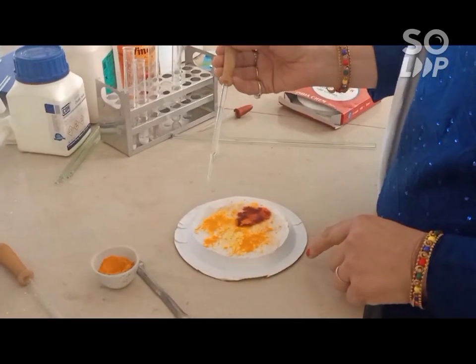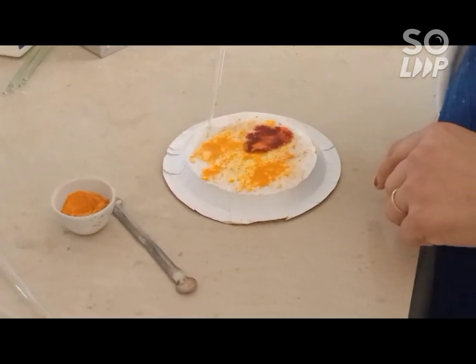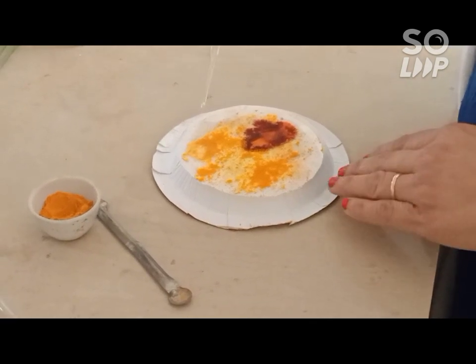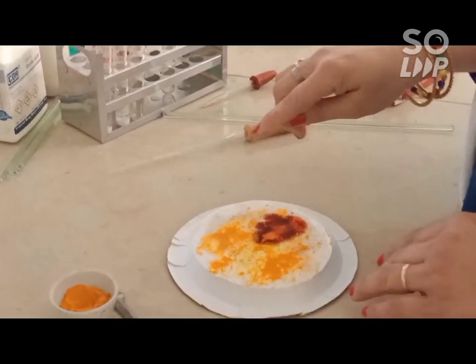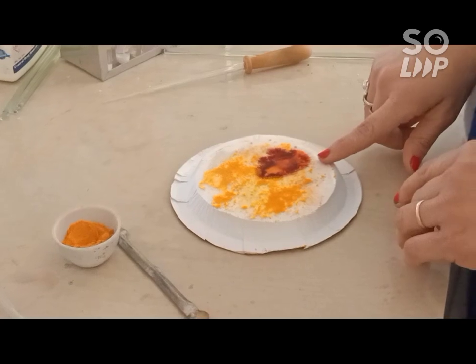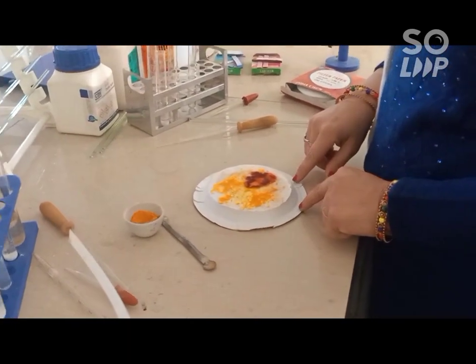Now let me take some acidic substance — that is vinegar, or we can say acetic acid. Now let's see: there is no color change in the turmeric. So we can say the turmeric indicator never changes its color in an acidic solution, and it turns reddish brown in bases. So we can use it as an acid-base indicator.